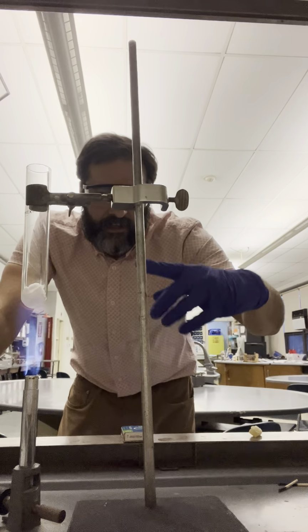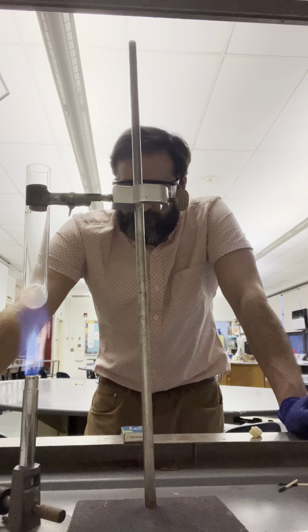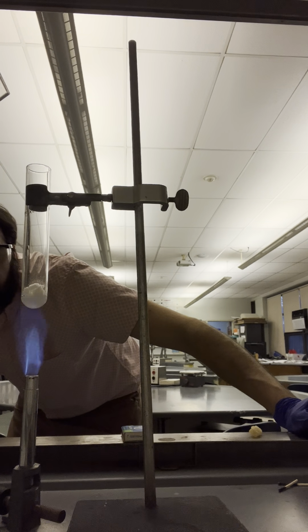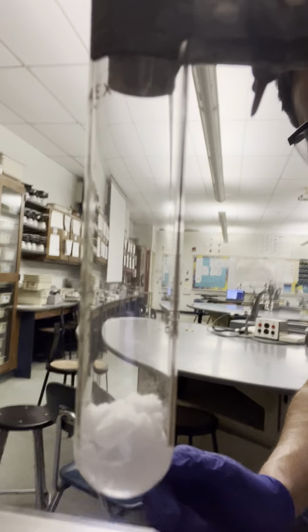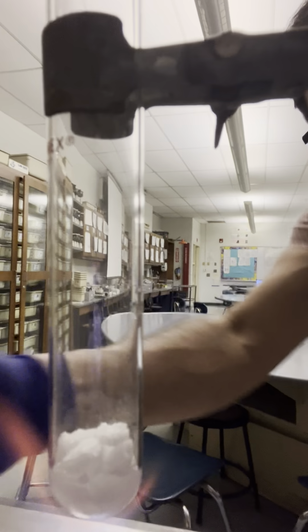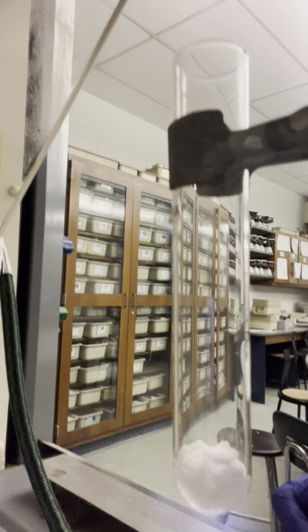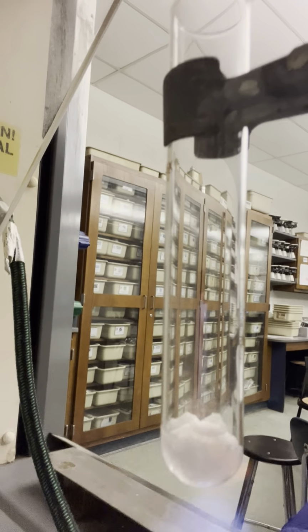Starting to see the compound fully melt into a liquid. Okay, I'm going to move the camera a little bit closer here. I'm trying to see. See the bottom area? The bottom is a liquid now. So we're basically ready to drop the pineapple chunk in. The bottom is nice and all liquefied. The top is still a little bit of solid. That's okay.